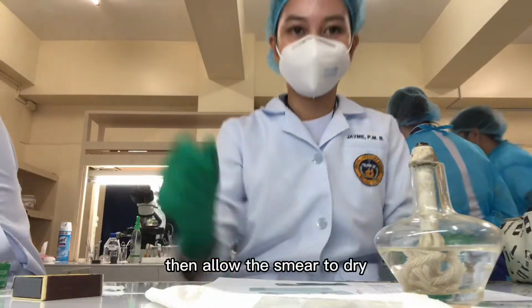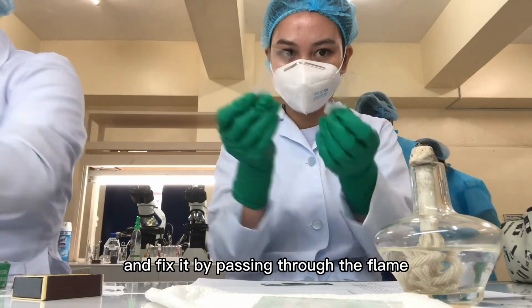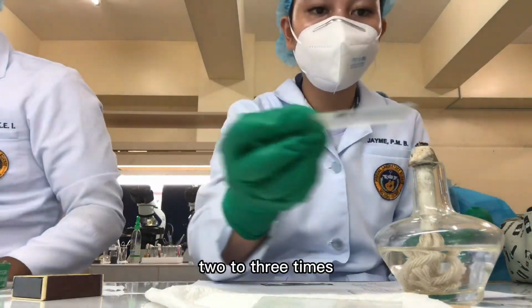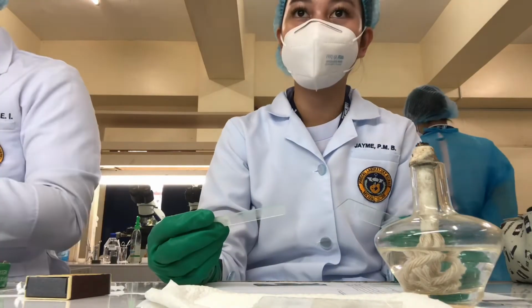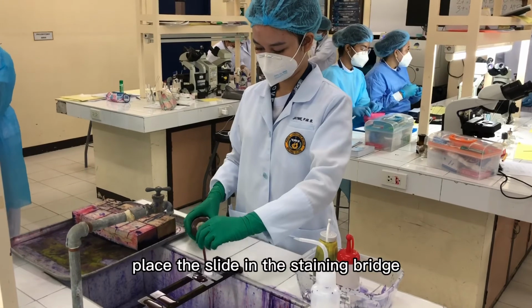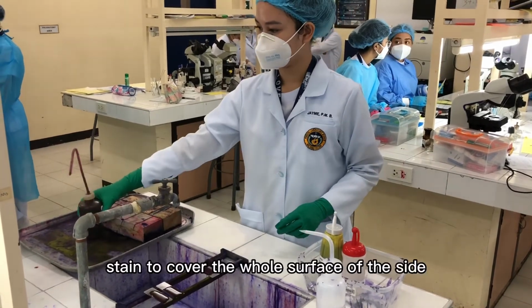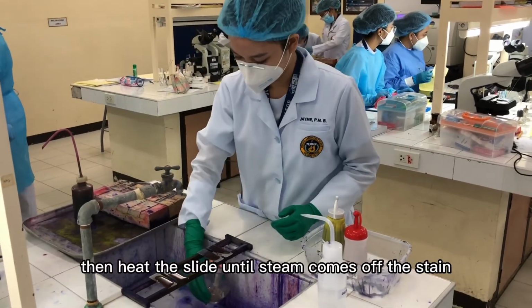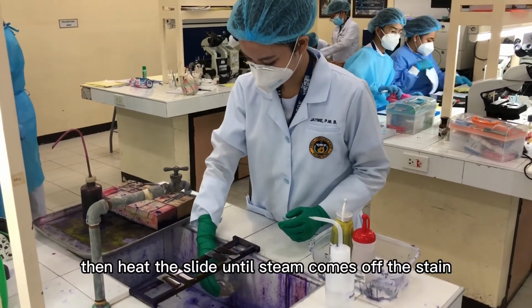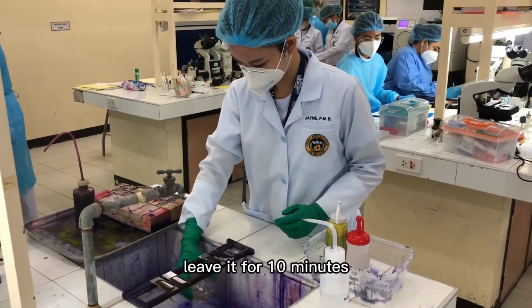Then, allow the smear to dry completely at room temperature for 15 minutes and fix it by passing through the flame 2 to 3 times, about 2 to 3 seconds each. Place the slide in the staining bridge. Using the Ziehl-Neelsen method, pour carbol-fuchsin stain to cover the whole surface of the slide. Then, heat the slide until steam comes off the stain. Do not boil and do not allow the slide to dry. Leave it for 10 minutes.